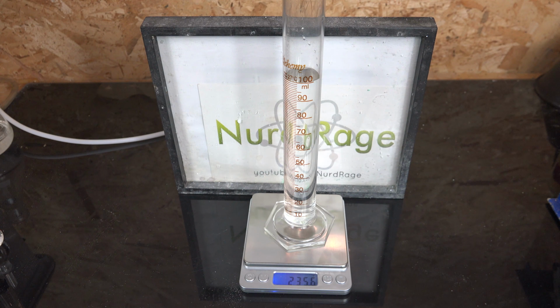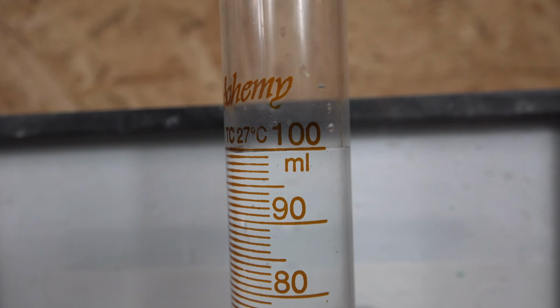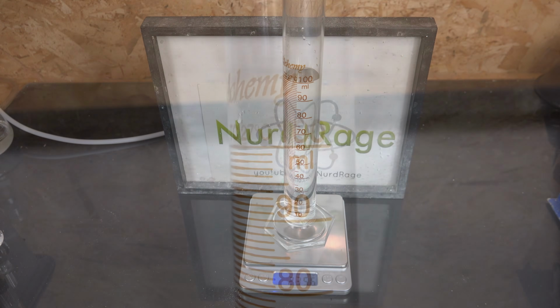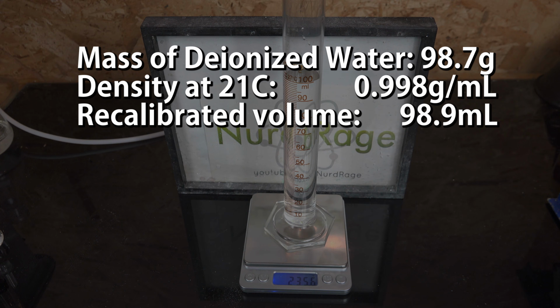This is because graduated cylinders aren't highly accurate as analytical devices, so they tend to have volume errors like this. Part of the error is from the cylinder being calibrated to 27 Celsius as it says right here on the scale. My lab is a little colder. You can recalibrate to some extent by dividing the mass of the deionized water by the known density at the ambient temperature to find the corrected volume for that temperature, and then using this corrected volume for subsequent measurements.